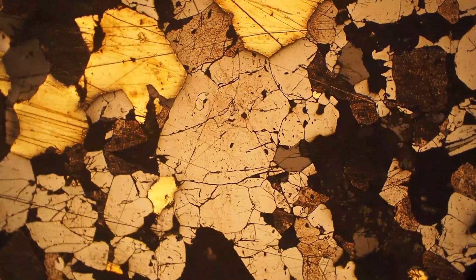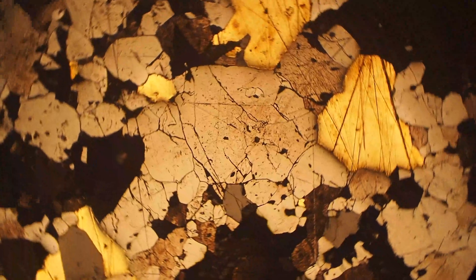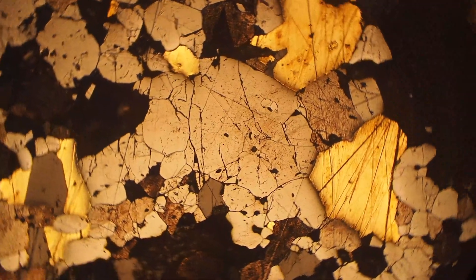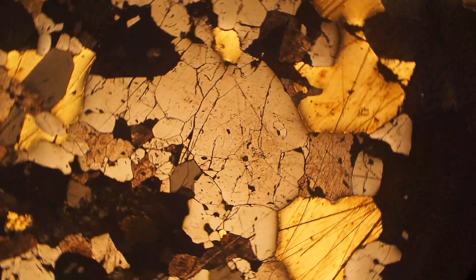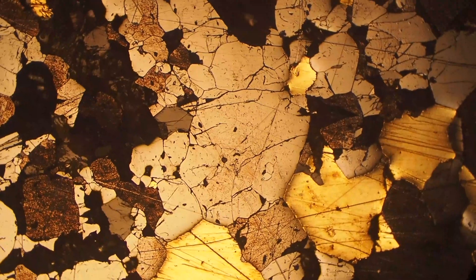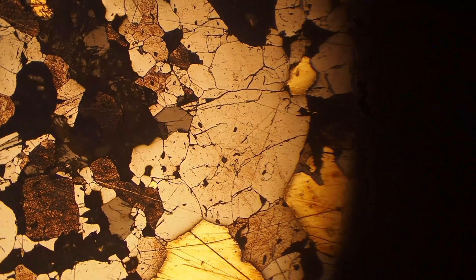We can also see the hardness difference here, where the yellow chalcopyrite is much softer and obviously lower in relief than the magnetite, which is higher in relief.